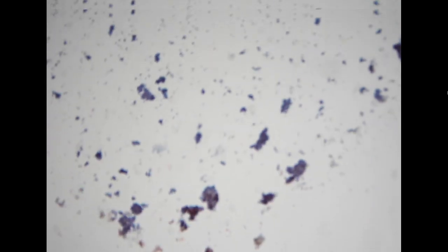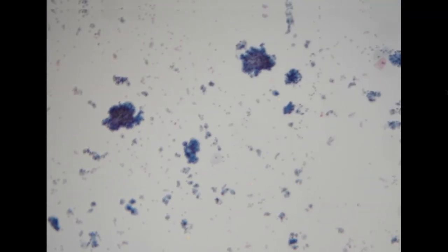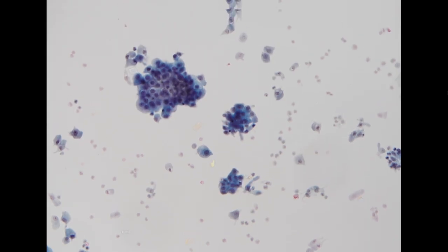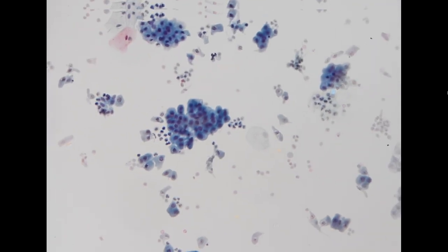So finally, this is a urine specimen. This is a cytospin specimen of, I think, a washing cytology. Yeah, catheter urine. The patient has a UTI, and this is her catheter urine. Because it is instrumented, we will see cohesive fragments of cells. So this is derived from the catheter, from the washing or from the catheterization. So you can see some fragments of the cells.